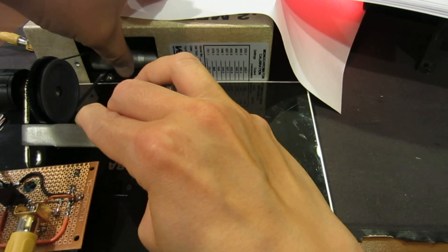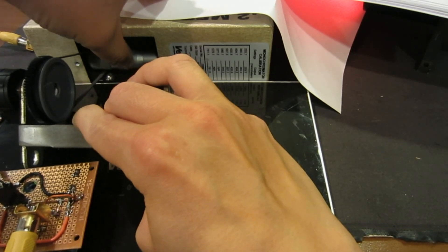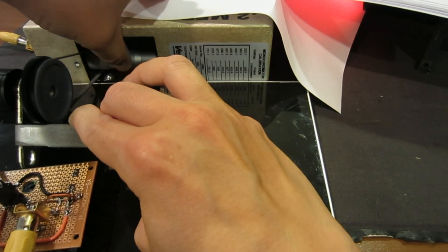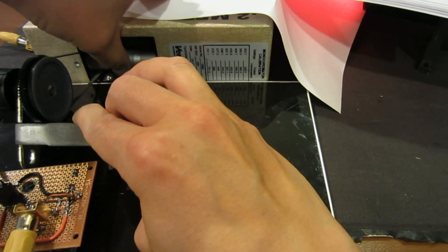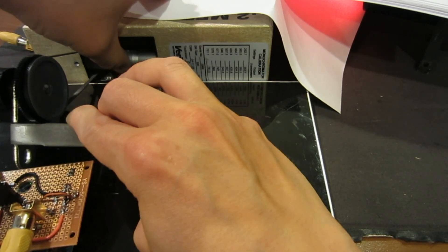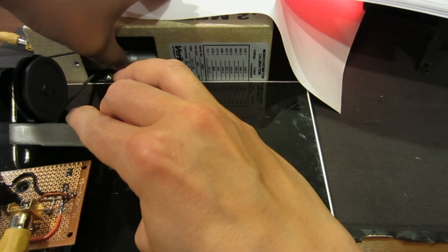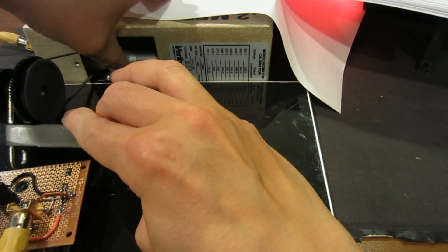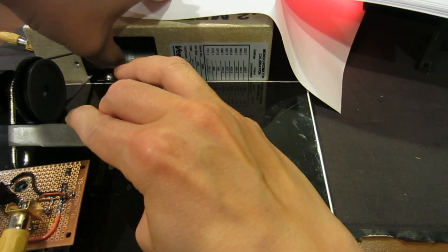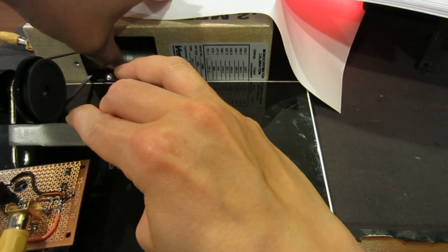This setup is very easy, although it's semi-automatic because you have to manually adjust left and right to make sure your belt is always following the dial. But it's actually a very cool way of doing this because you are not really modifying anything. At the end of the day, after you take out this belt and this cogwheel assembly, your monochromator is still the way it was. So it's very non-intrusive. Of course, you can motorize this, but the mechanism would probably be a lot more complicated.